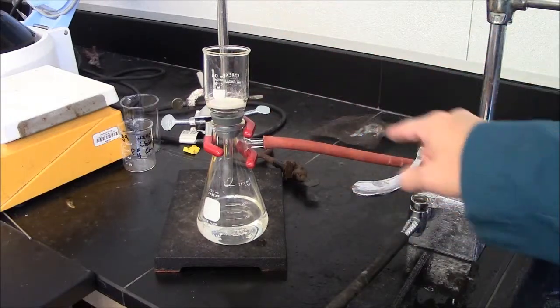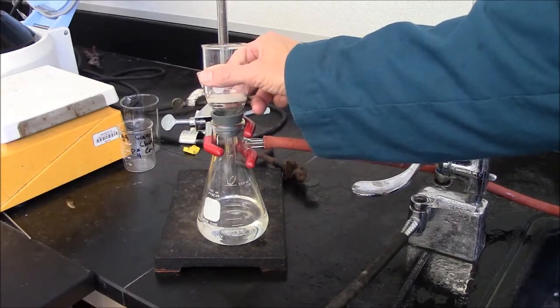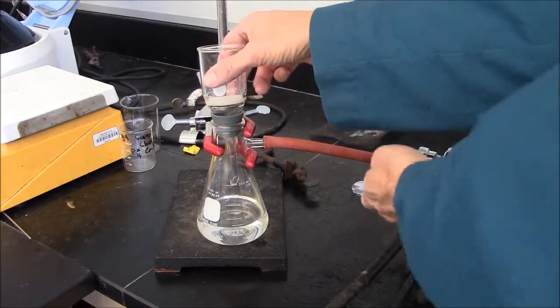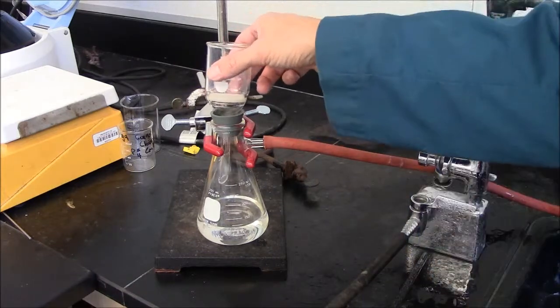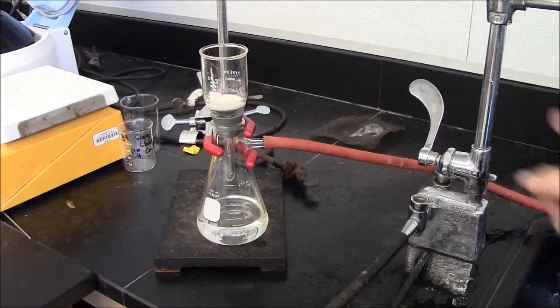Before I turn off the water, I need to break the vacuum on this side. I can hear it sucking the air now. Turn off the water. If you don't break the vacuum first, you can get water spilling back.